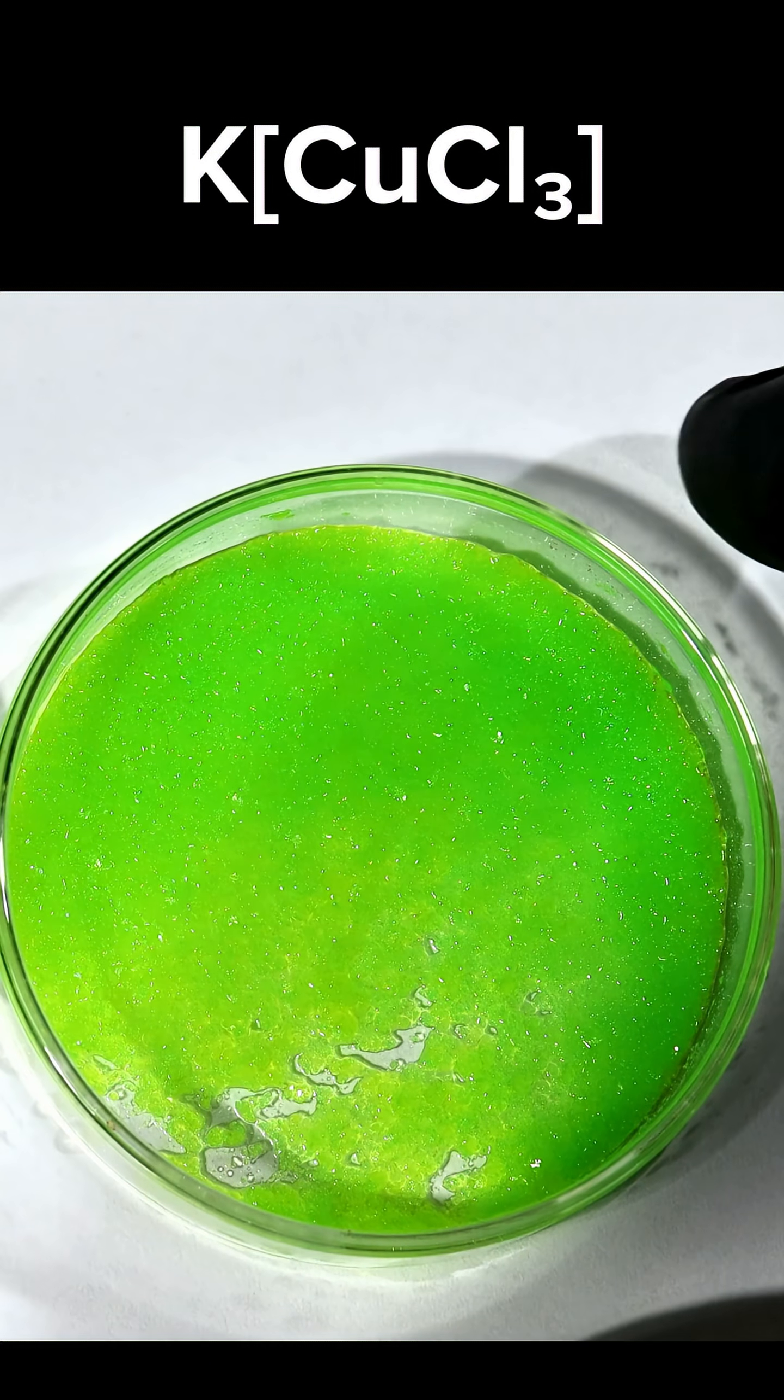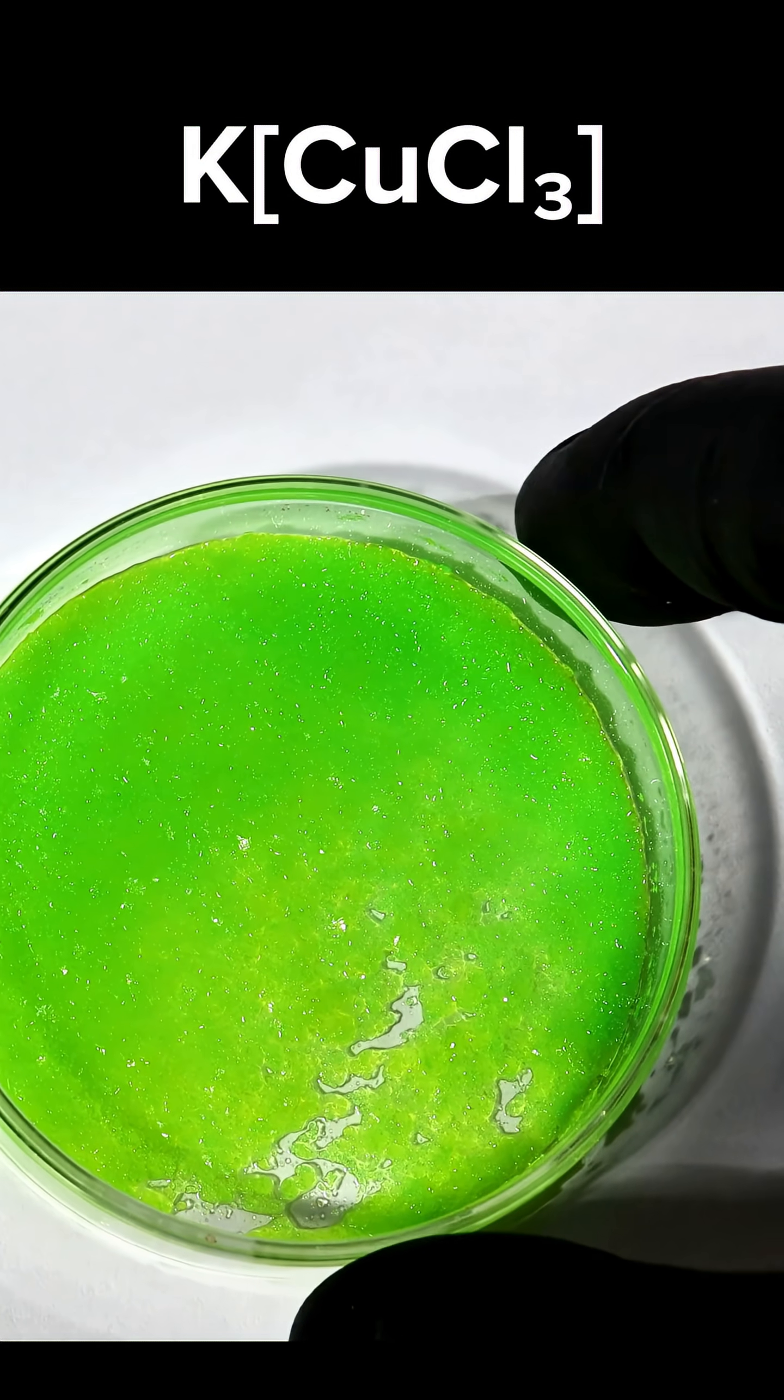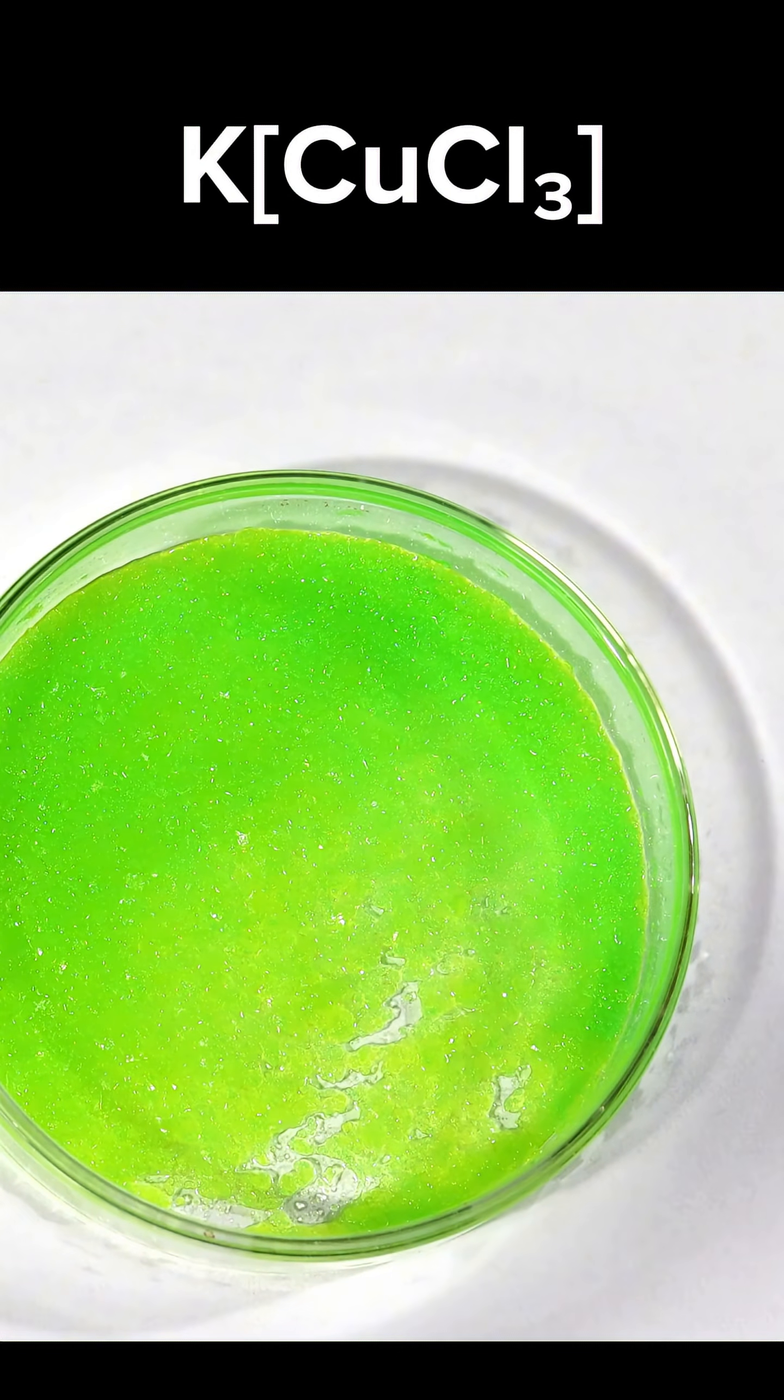In this way, cesium is entirely unique, as its enormous atomic radius allows it to precipitate compounds that would be otherwise impossible.